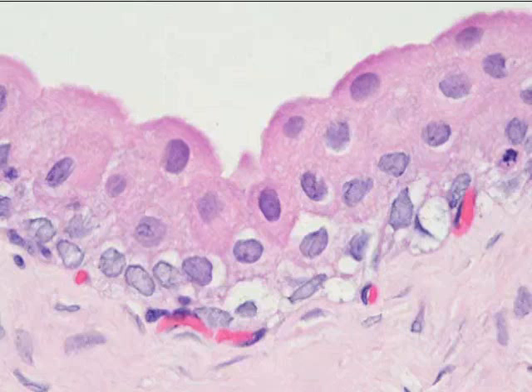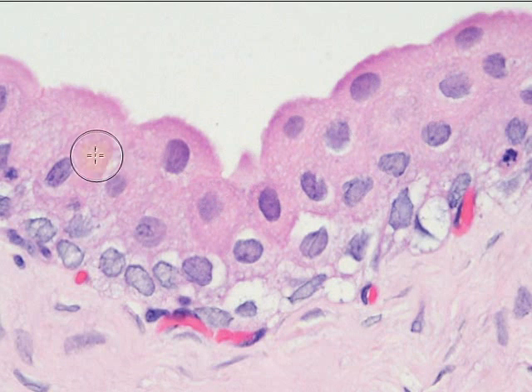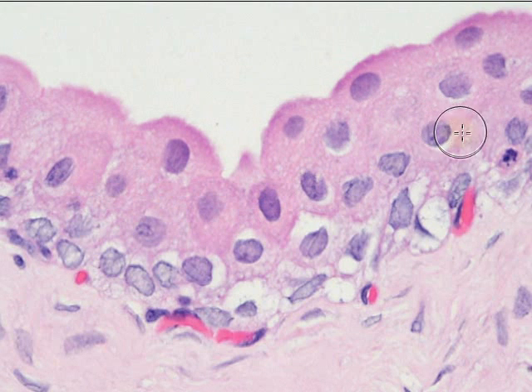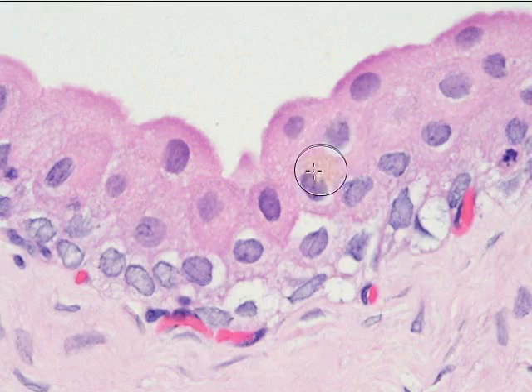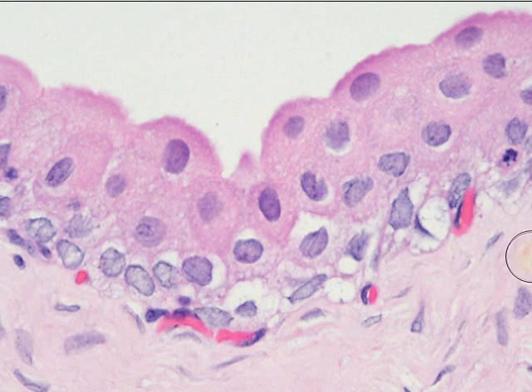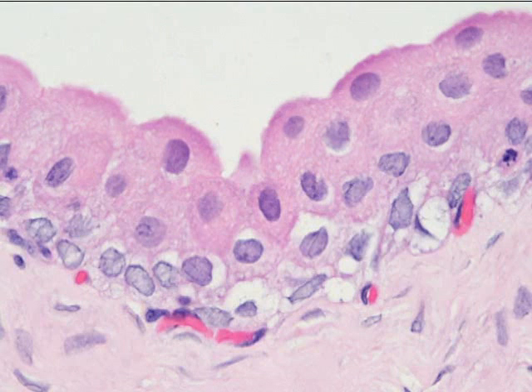the bladder is empty and the tissue can recoil back to its original shape. So the transitional nature suits this tissue shape really well. When you look at these layers, there's not clear layering like we see in the stratified squamous tissue. These round cells, like bubbly bubble wrap cells, are kind of all just piled together haphazardly, and that's important for the flexibility of this tissue as it distends and stretches out.